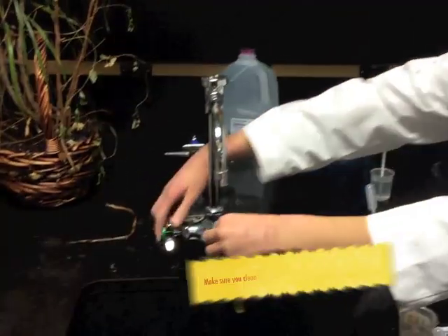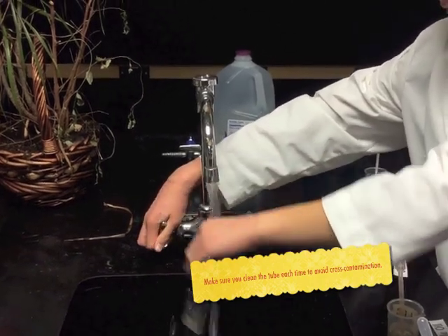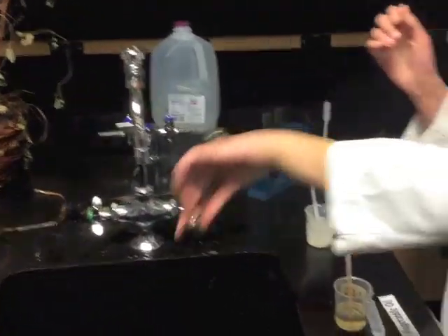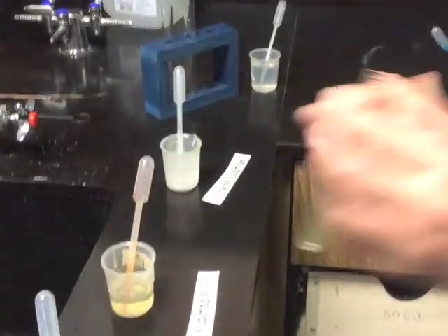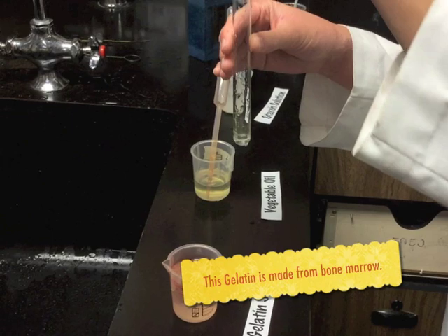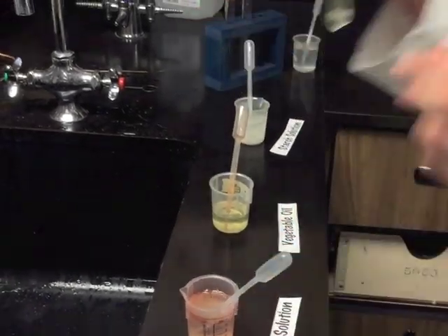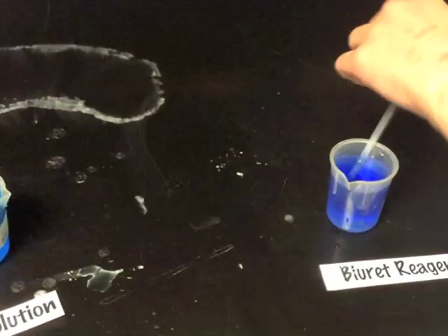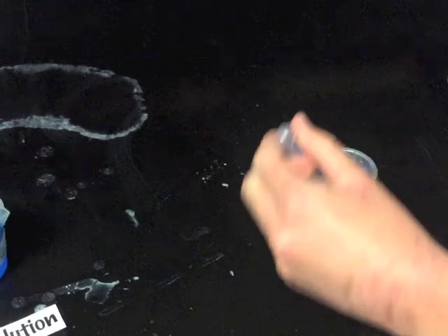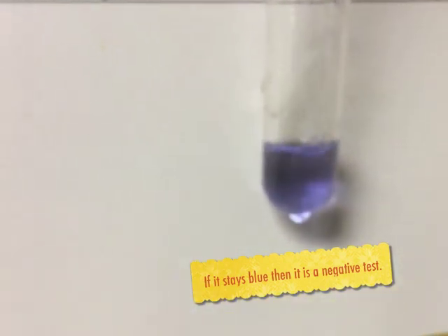After that, dump out your test tube and clean it. Once you've cleaned it out, we'll test for proteins. Add just a tiny bit of gelatin solution — a little more than a small amount should be good. Then add about an equal amount of Biuret reagent to test it. You'll notice it turns purple because there are proteins present.